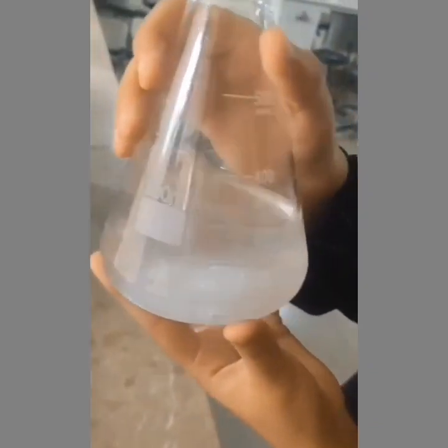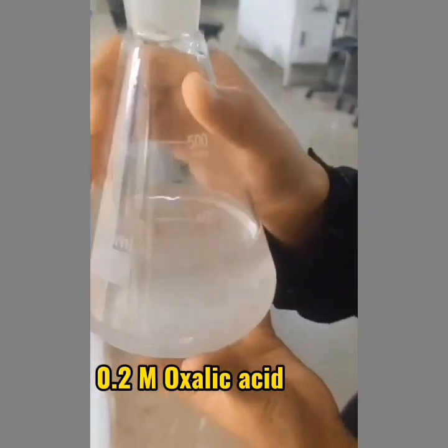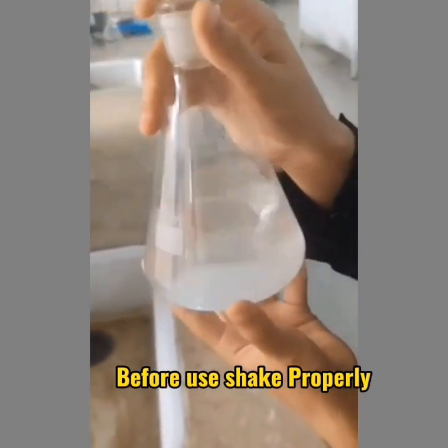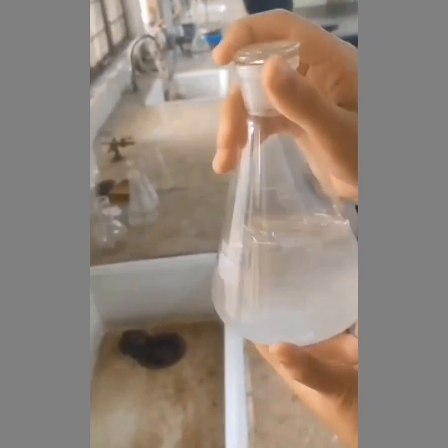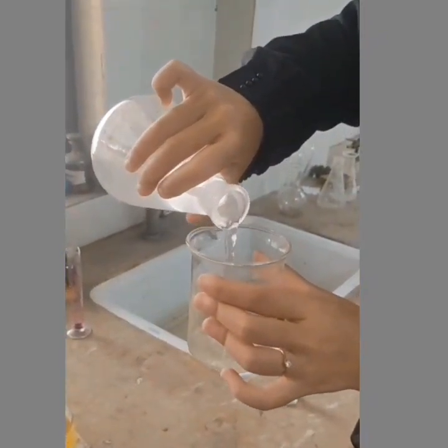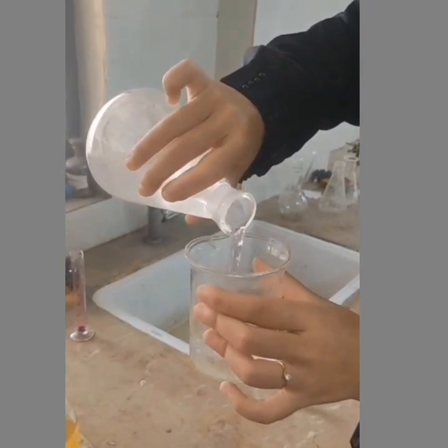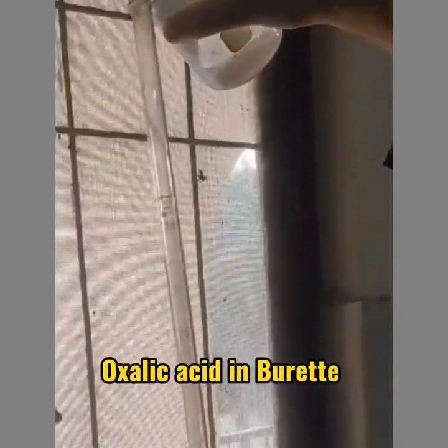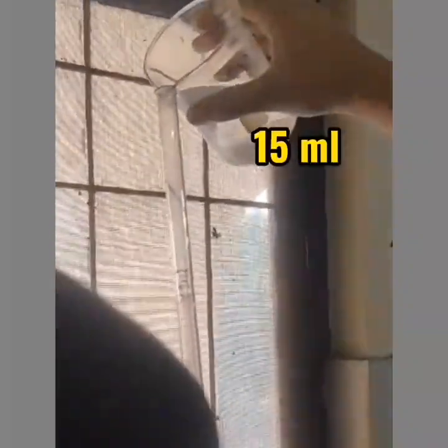This is oxalic acid and we take 0.2 molar oxalic acid in the burette. Before we use oxalic acid, shake properly. We add oxalic acid in the beaker before adding it to the burette. We add oxalic acid in the burette and we take 15 ml oxalic acid in the burette.